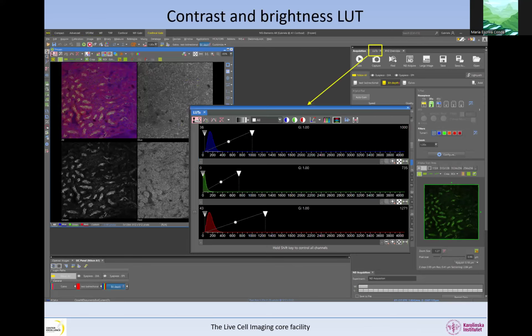This is the one that resets, and here is the manual. They all look very similar. When you click on auto scale, the display is going to show you as black the minimum in the image, and it will show you as white the maximum in the image, instead of showing black and white for the whole bitmap. So instead of 0 being completely black and white being 4095 in a 12-bit image, it's going to show you black and white only for what you actually have in the image, the dimmest and the brightest pixel.